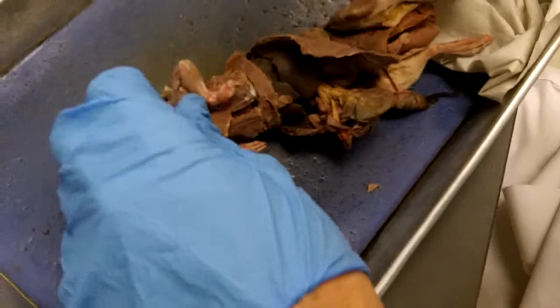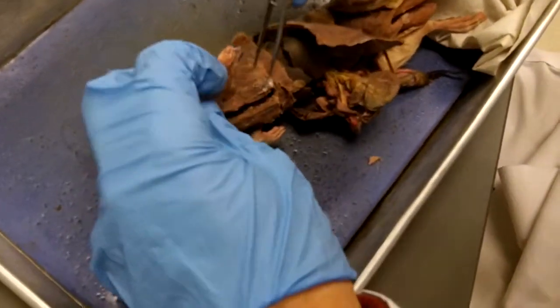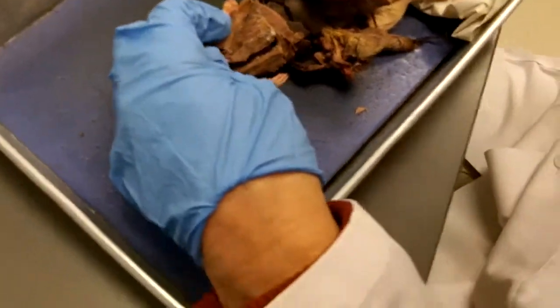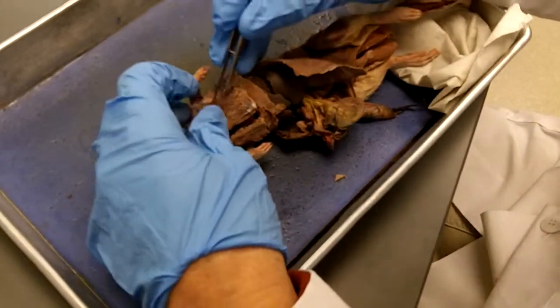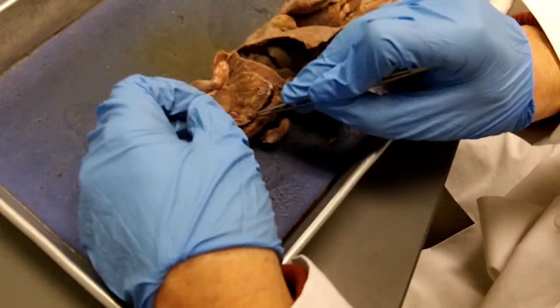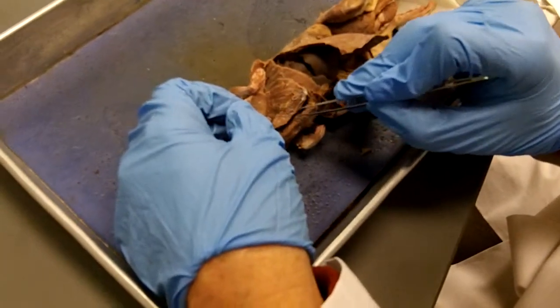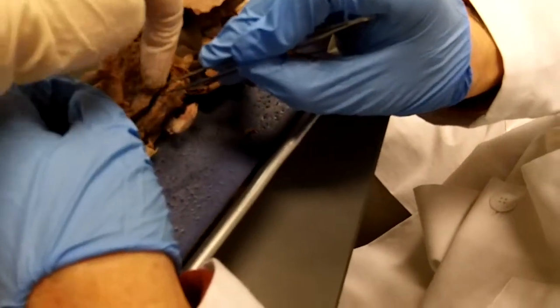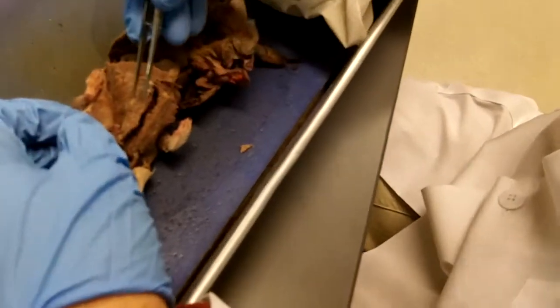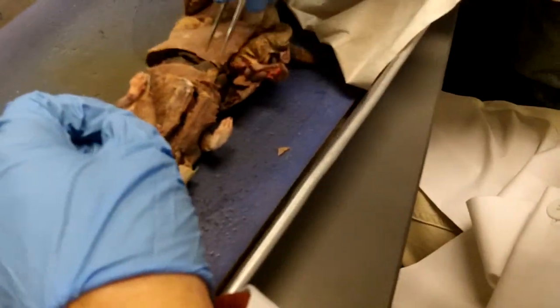If you cut the pectoralis, this isn't a very good example, but if you cut pectoralis, then there should be a little tiny strap-like muscle, really thin, that runs across. This is rectus abdominis right here. And it ends around there, because on the mud puppy it goes all the way down, right? Yeah, I think it keeps going further down. So that's rectus abdominis.